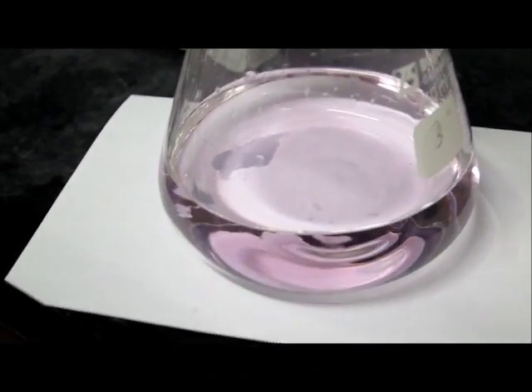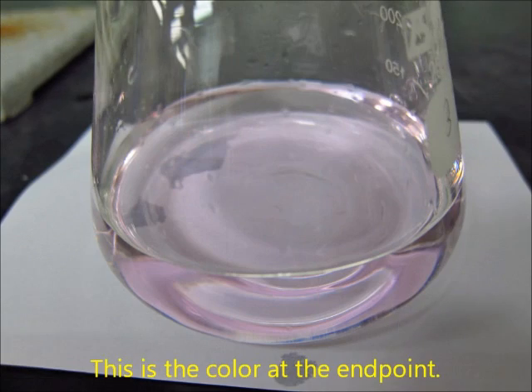Once again, take a close look at the colour at the endpoint. Remember the colour.